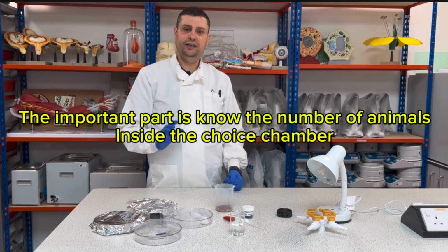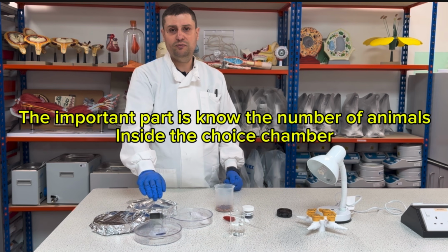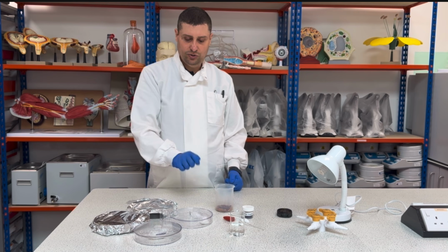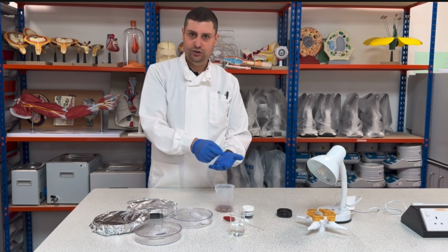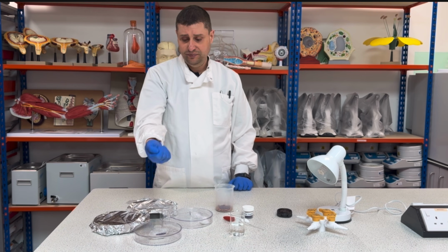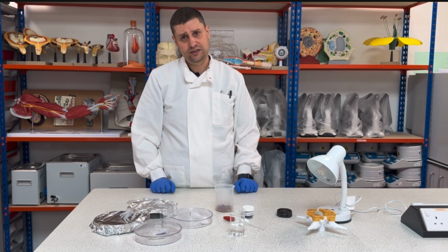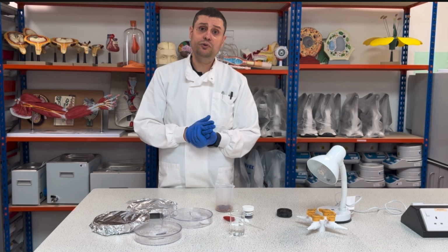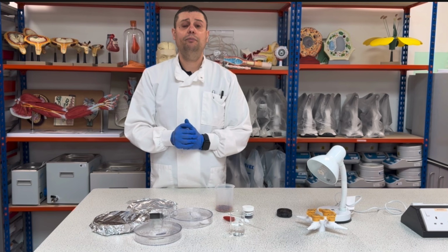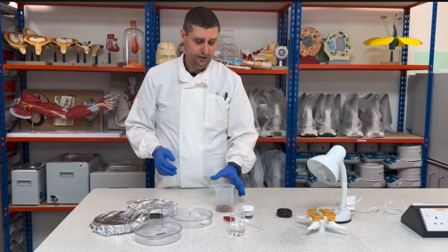The important part is that the number of animals you place inside is counted. So you can pick 20 right here, or you can place a spoon here and count how many go inside. The number of animals is very important, so you can work with the percentage afterwards.